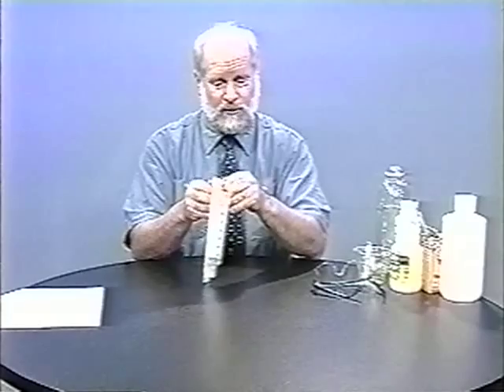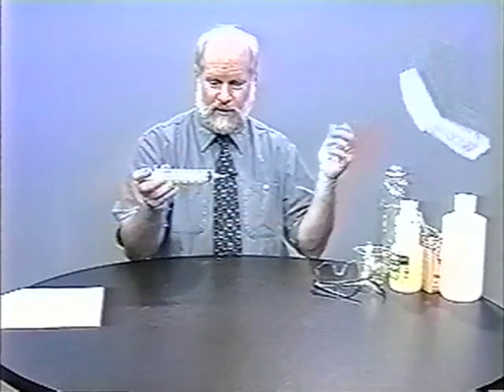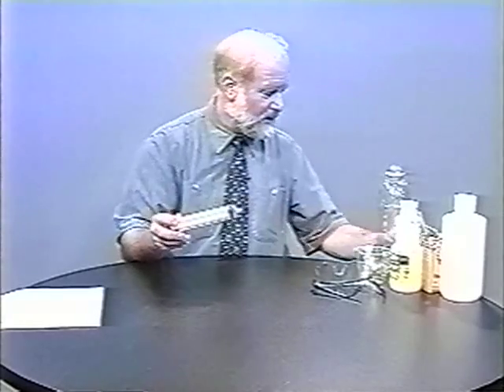Let's look at the equipment you would need first to get started. We need some place to generate gases, and we do this with syringes. Syringes come wrapped in funny little wrappers. We get rid of those, and they come with a blue tip on them — every syringe I've seen. These are also of no use to us.